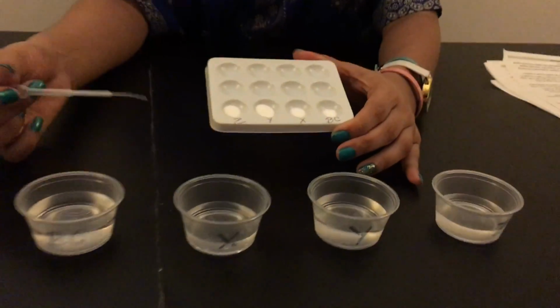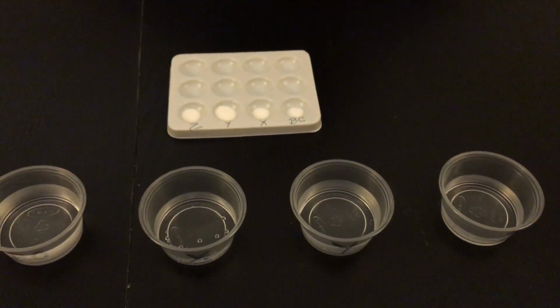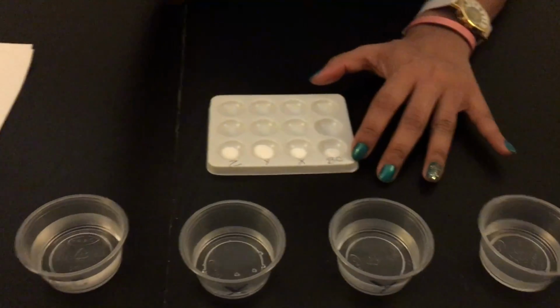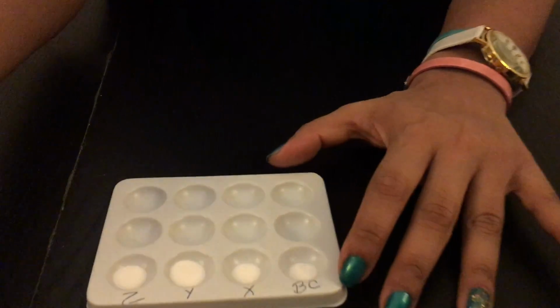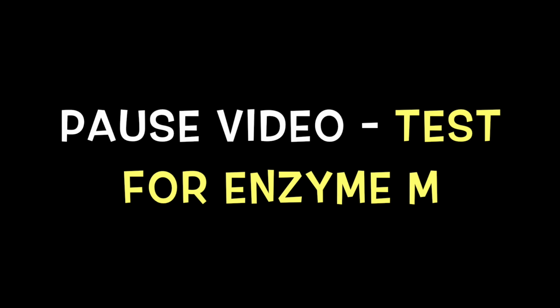In order to complete the test, powder is placed in each of the 4 wells of your tray. You can label them Botanicurus, X, Y, Z based on where you plan to put the plant extracts in. So for Botanicurus, I will use my pipette, take some plant extracts from Botanicurus and drop it into the Botanicurus well. Place it in the well indicated for Botanicurus and observe what happens.